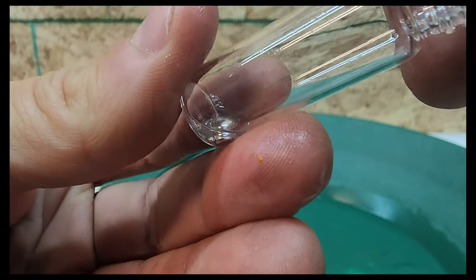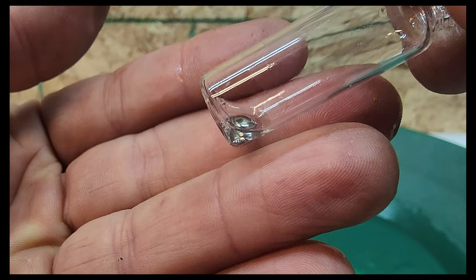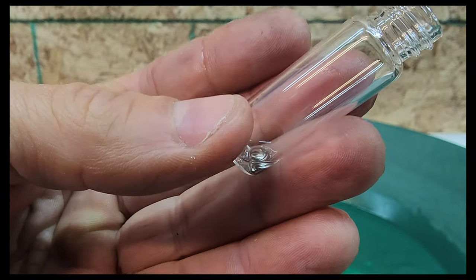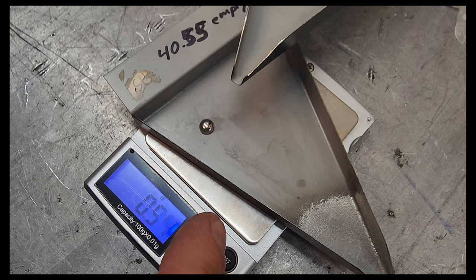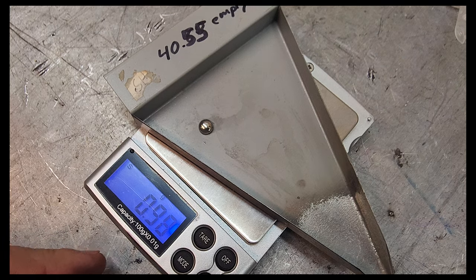What I want to see is the total weight to be the same between this and the gold, to confirm I haven't lost any vapors into the atmosphere. So within the accuracy of my scale, I'm going to get a weight and let you know how we did. 0.97 grams… 0.98. Okay, now I'll weigh my gold.